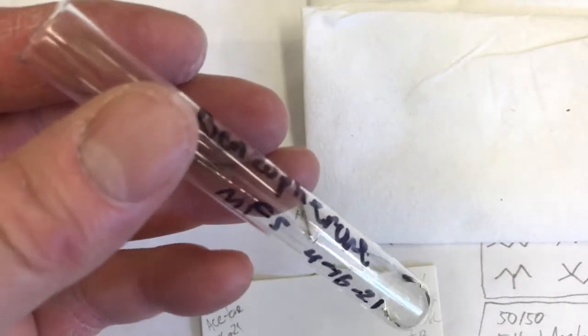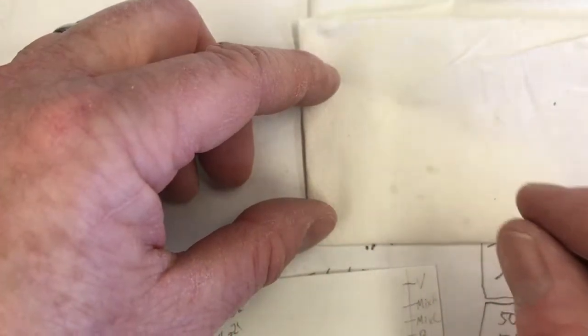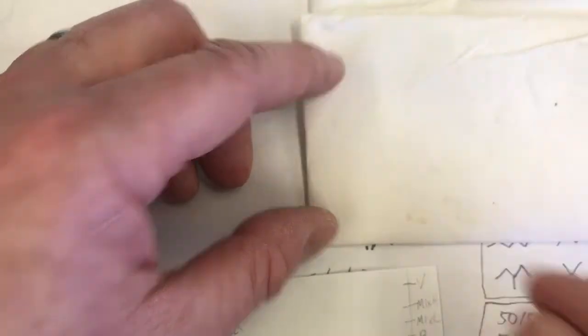Put that in the waste container. Grab my benzoin. I'm sorry, benzophenone. There's too many Ben names, huh? Benzophenone. Put that on the paper towel, drain it mostly. All right, and now benzophenone. Boom. Oh, I didn't spot that one great, a little above the line, but I know it, I'll remember. I think it'll be okay. All right, so I've got those all spotted on there.